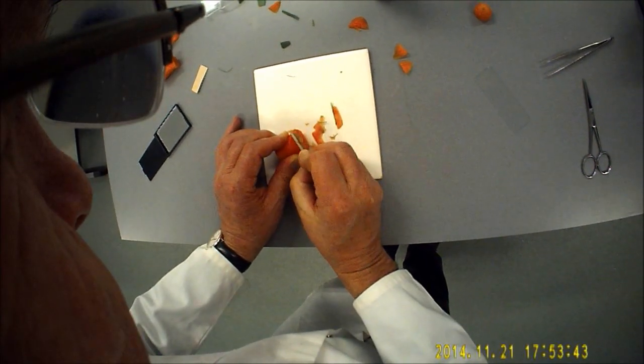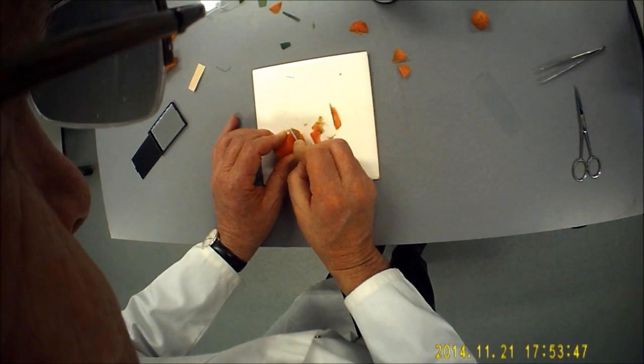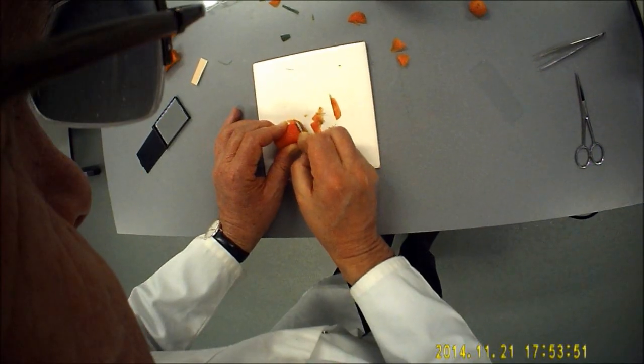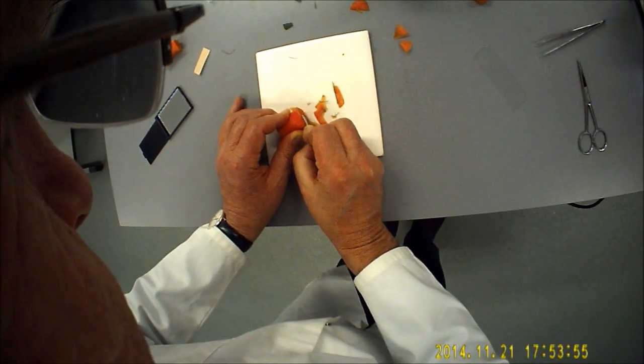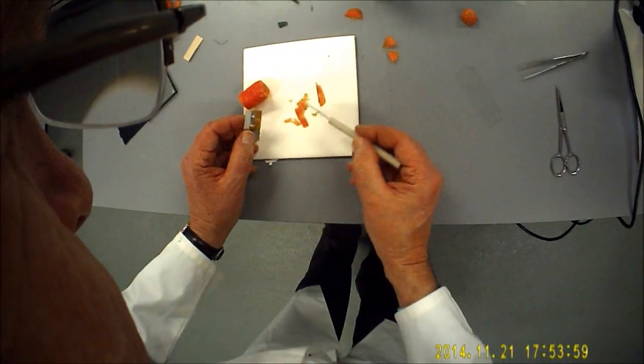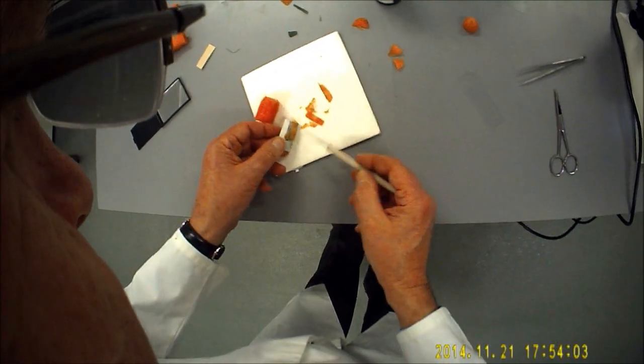This is using the same technique that a high-tech gadget, well relatively high-tech, called a microtome uses. Right, so there we are. Let's see what we've managed to harvest. So we've got one or two specimens there.